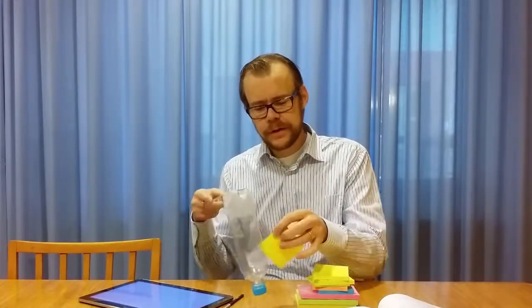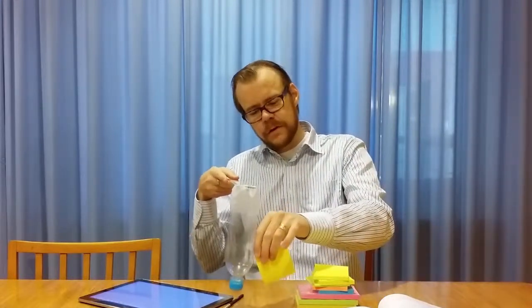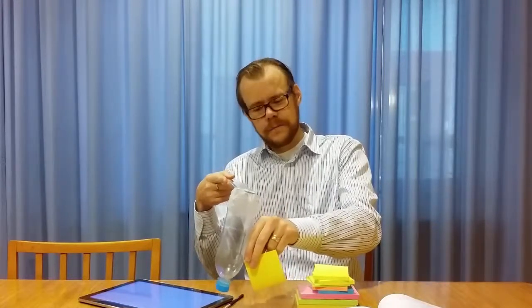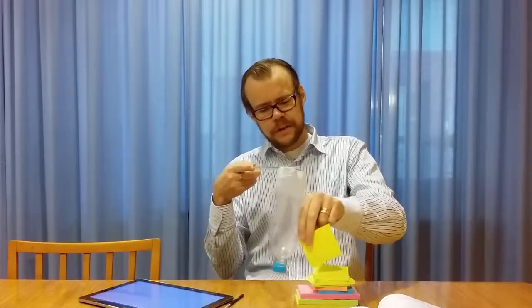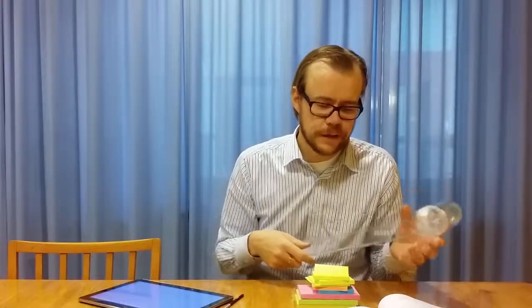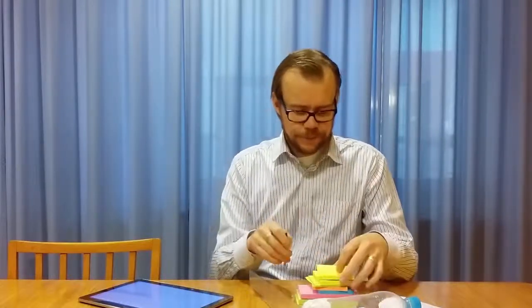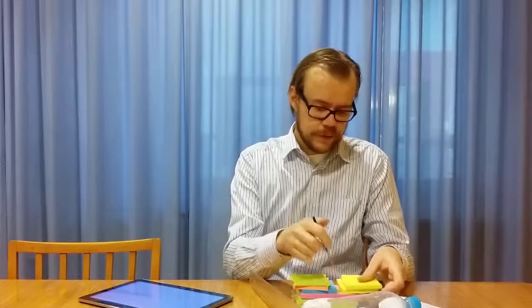And this is very apparent if, for example, the debris is placed in such a position that you get something like this. So you get two tips. Then the first one will scan the object, and then the second tip will scan the object. So then you get doublets or ghost images in your final image, because you scan the surface with two tips. Another problem that you can have is that, let's say you have a very, very sharp object in the substrate.